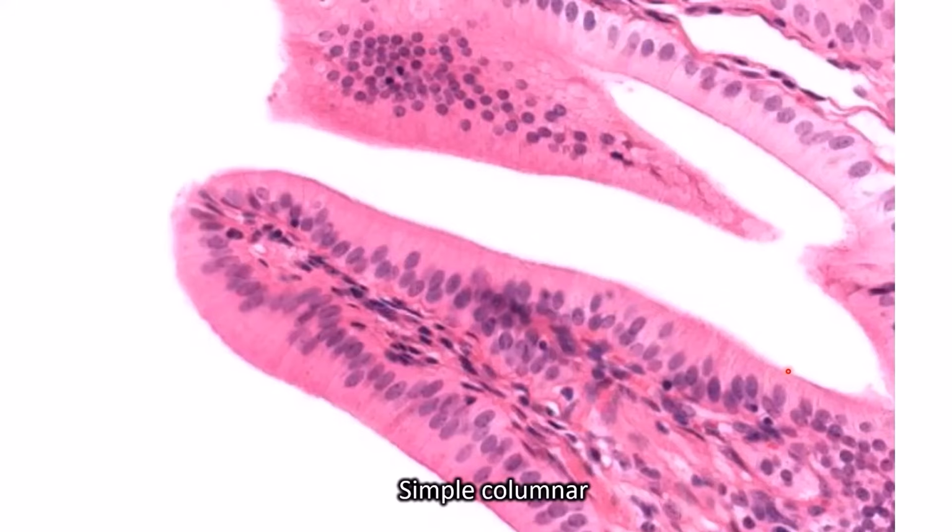It's just something about the way they cut it. This part here is like perfect textbook simple columnar, where it's very clearly only one layer of cells. But oftentimes it does look closer to this, where it almost looks like there's multiple rows of cells. But once you see enough examples, you'll realize it's just kind of a mirage.